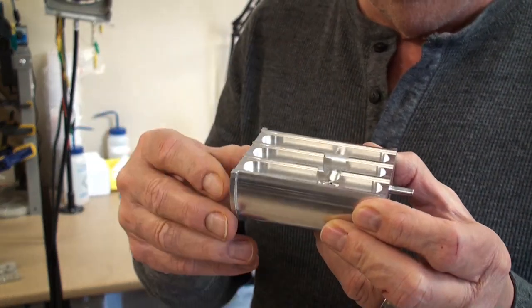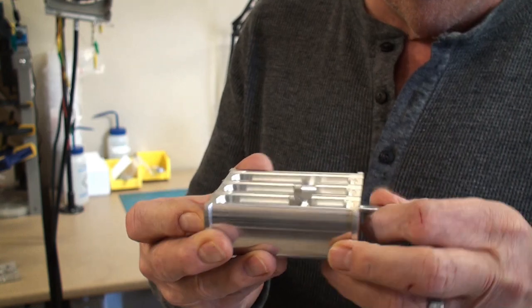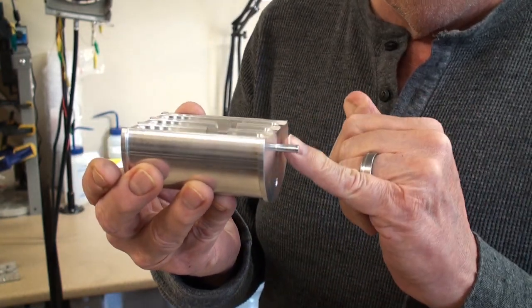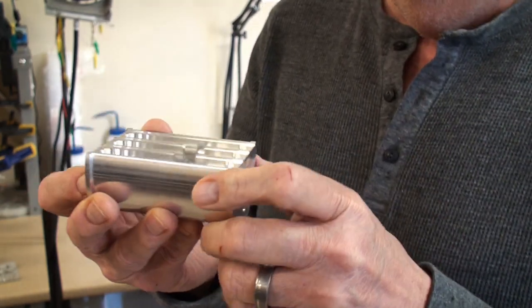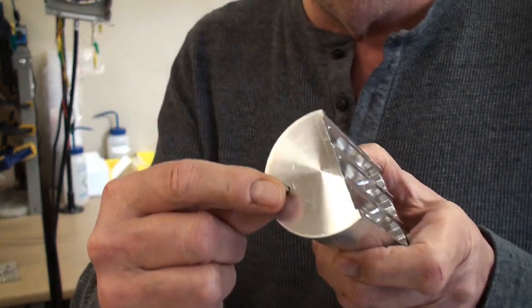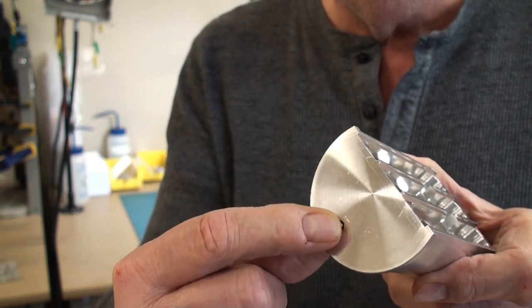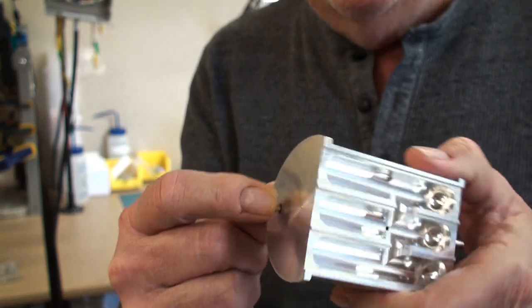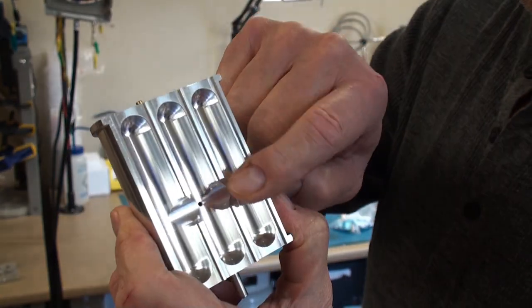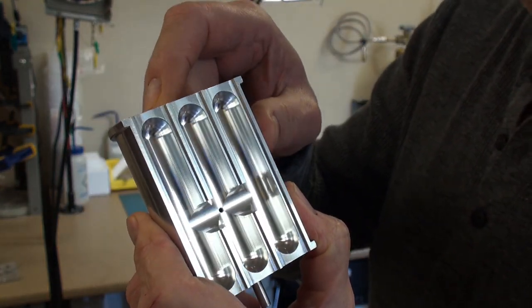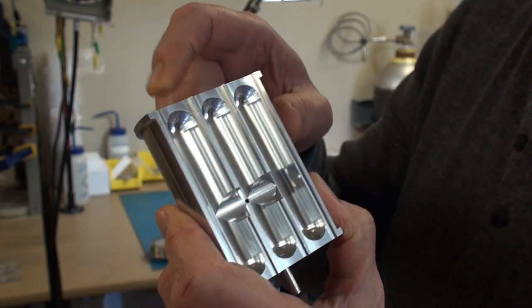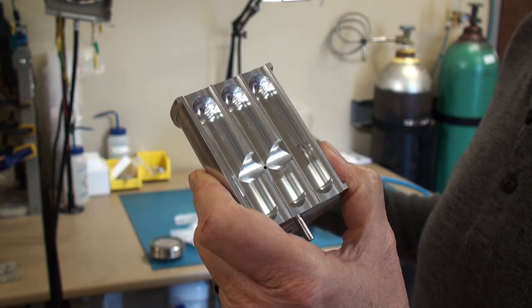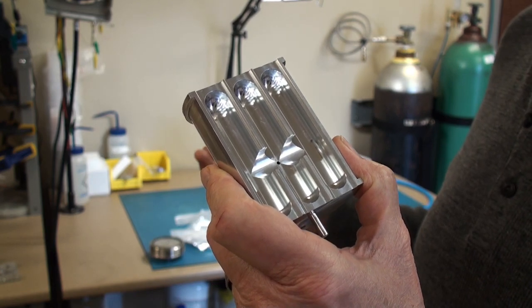And I say resistant because eventually with the pressure and the acetone the O-rings will start to leak and need to be replaced. But you can put your intermediate fluid in this trough keeping your samples wet and slide the whole thing into the chamber with this pin pointing out. And underneath when you slide this forward there's a button which actually opens the valve. That little pin hole drains all the alcohol out of your sample which you'll see during the actual operation of the system.